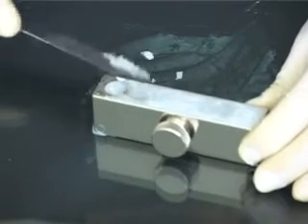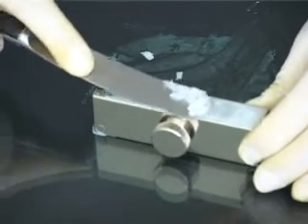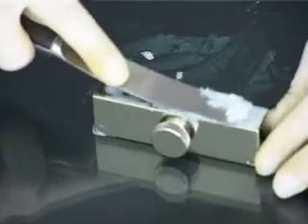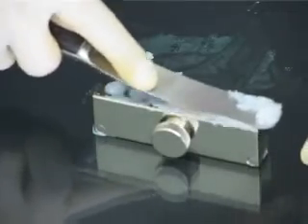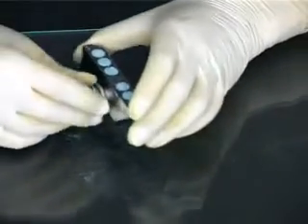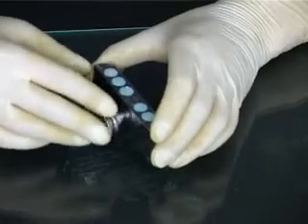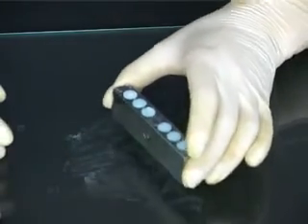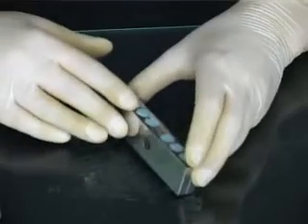When the suppositories have contracted but not completely set, trim off the excess fat using a warmed spatula, either by cutting through the fat or by rubbing the flat blade of the spatula over the top of the mould. After further cooling, loosen the screw of the mould and tap sharply on the bench. Remove the suppositories carefully — do not attempt this until the suppositories have completely set.